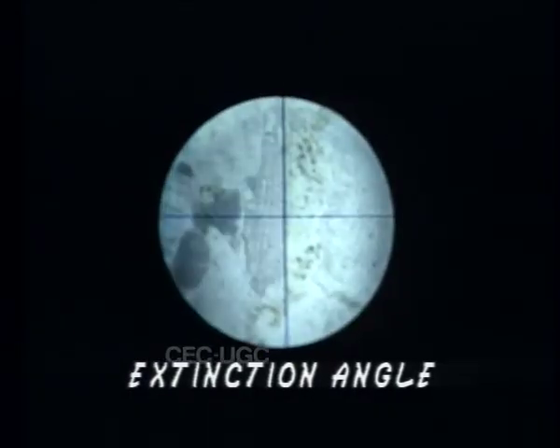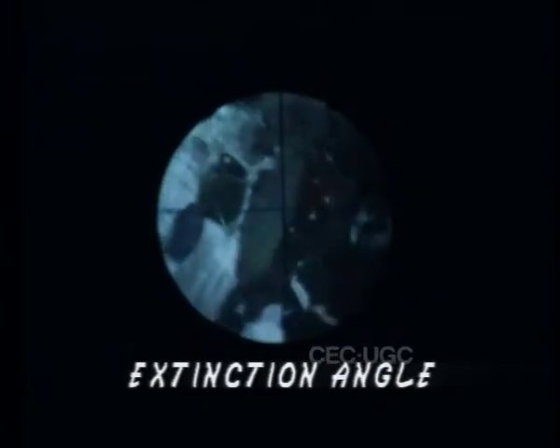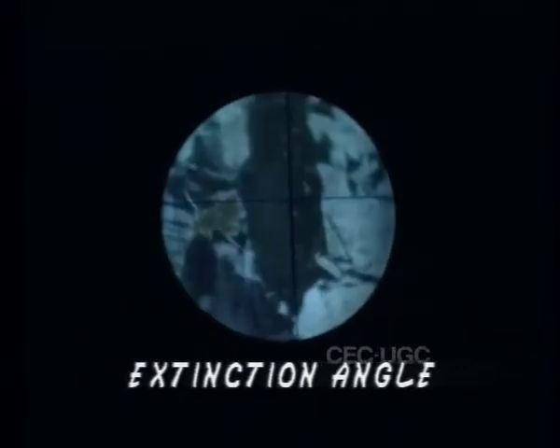In uniaxial minerals, we will find that at extinction position, the elongation direction or cleavage lines of the minerals are parallel to one of the two hairlines of eyepiece. You will recollect that the orientation of these hairlines corresponds to the vibration direction of polarizer and analyzer. In this case, extinction angle is 0 degrees. It is called straight extinction.